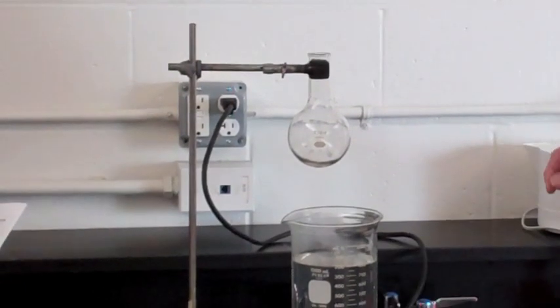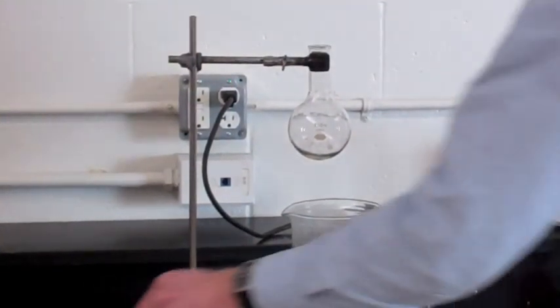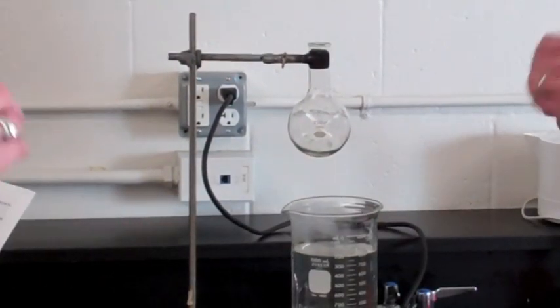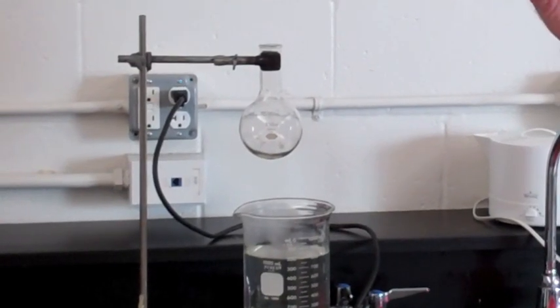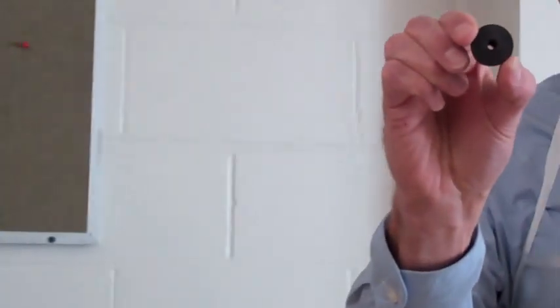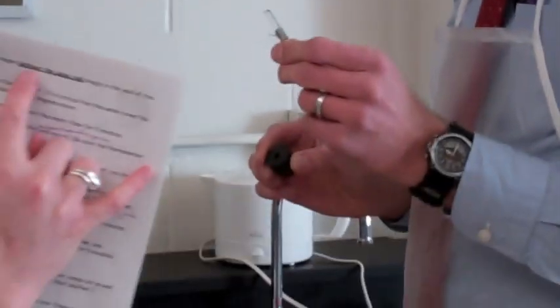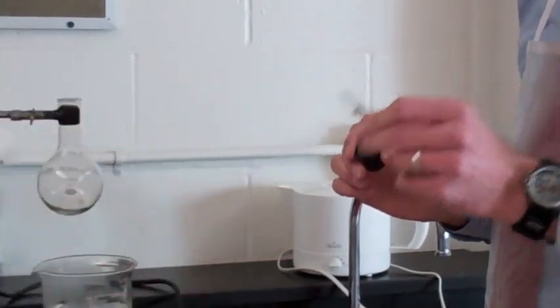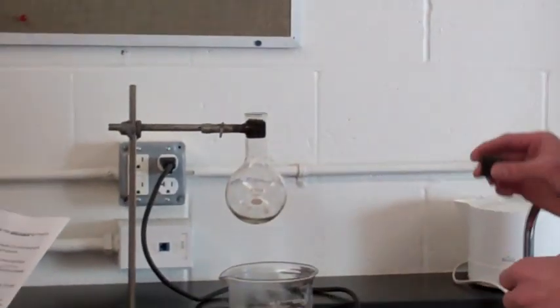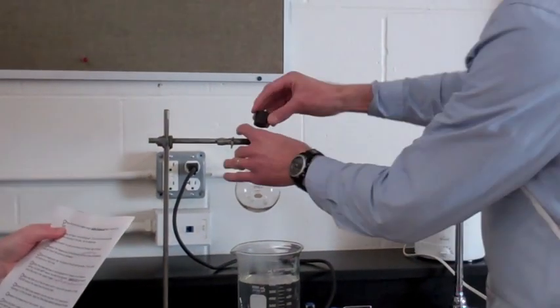Place the one-hole rubber stopper without the glass rod. No glass rod. Bring it in closer. Double underline bolding: Don't lose the glass rod, so leave it in your tray. Snuggly in the neck of the flask.